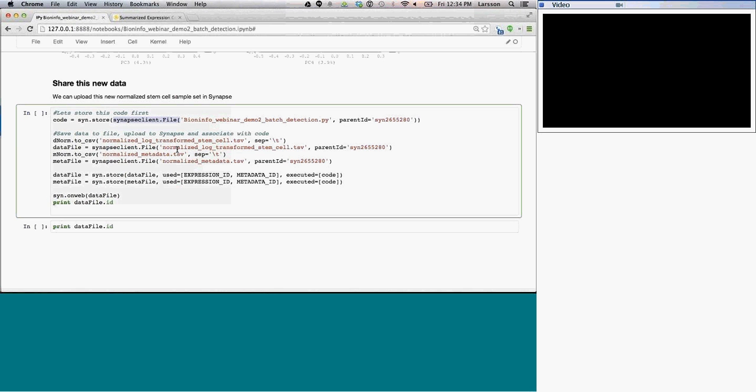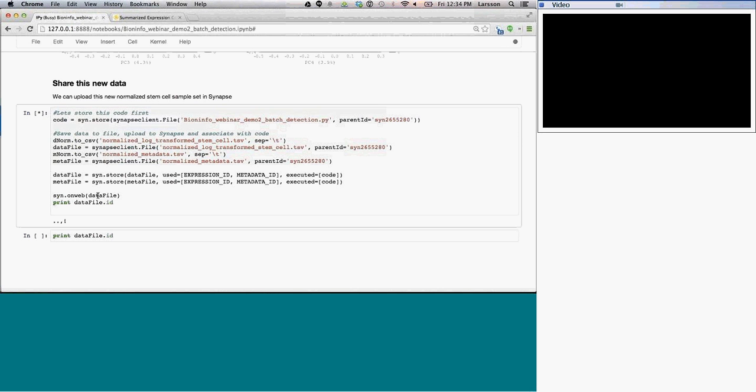So this is the data set that has been filtered down to the same set of samples. And then last, I do two things where I store them on Synapse. And then just to show, I'm going to open them up on the web as well. So this now writes the files to disk and pushes them up to Synapse. The progress bar that you see there at the bottom is the progress of storing them on Synapse. And that's actually storing data sets, so it's a little bit larger, takes a little longer. And then the last thing is going to be to store the metadata.